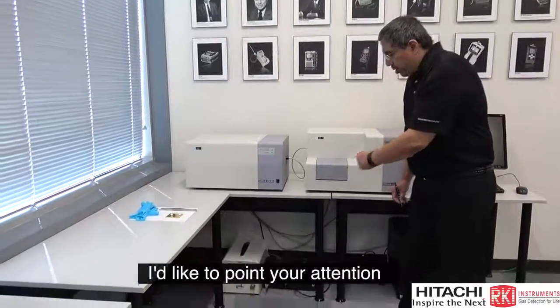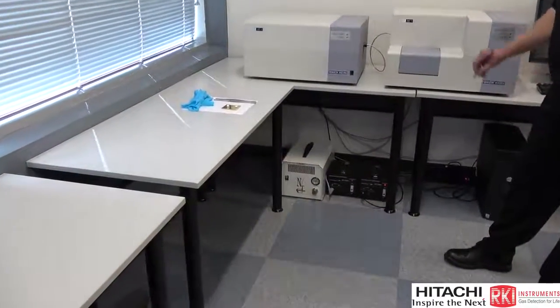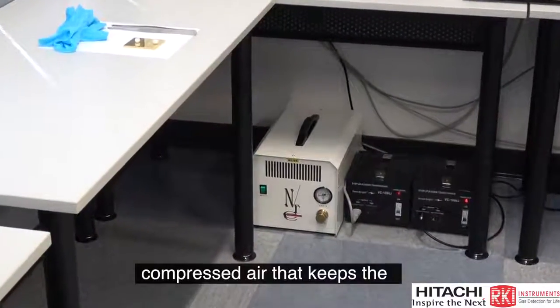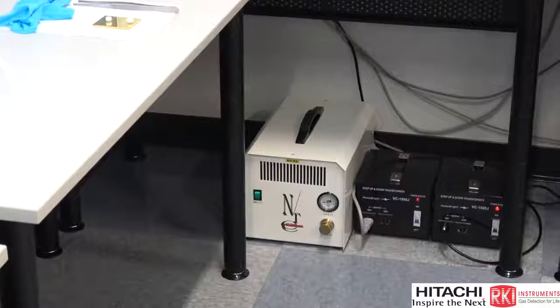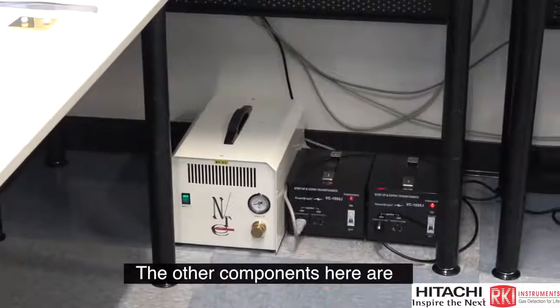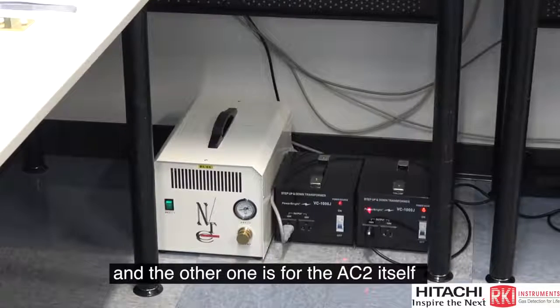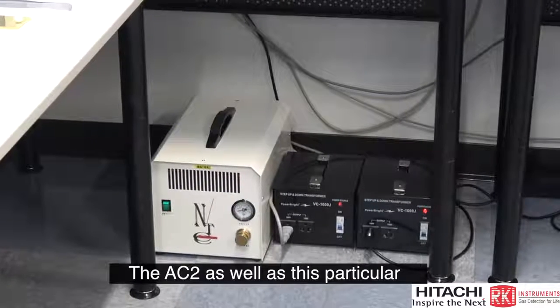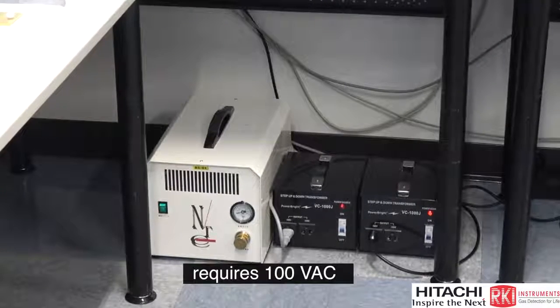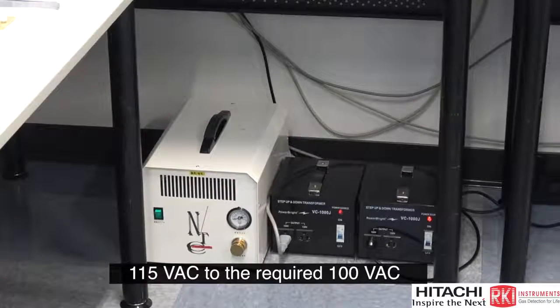I'd like to point your attention to a couple of components that the AC2 requires. One is compressed air. Here I have a portable compressor that basically is supplying compressed air. That keeps the sample path nice and dry, free of moisture, and under a slight positive pressure. The other components here are power transformers. One is for this air compressor, and the other one is for the AC2 itself. The AC2, as well as this particular portable air compressor, requires 100 VAC. So obviously they're converting North American 115 VAC to the required 100 VAC.